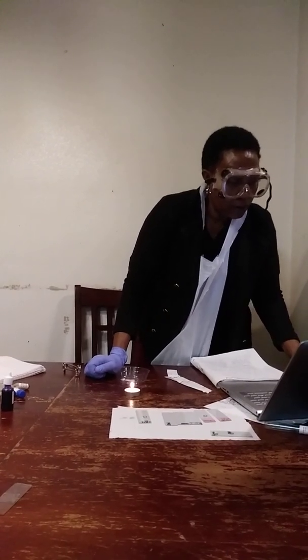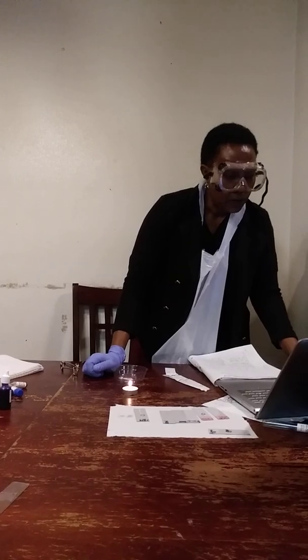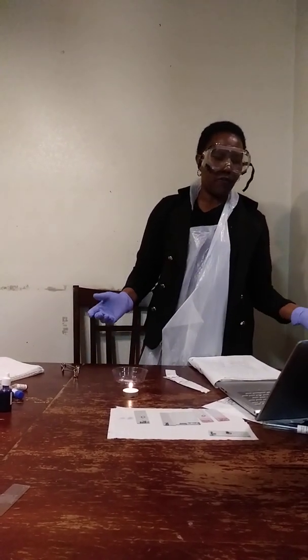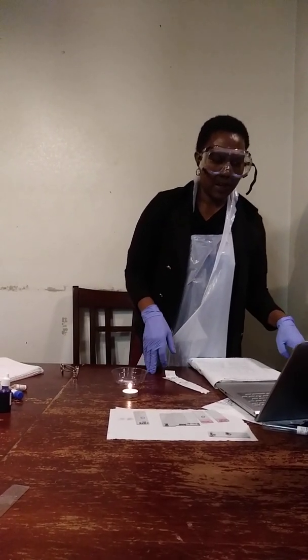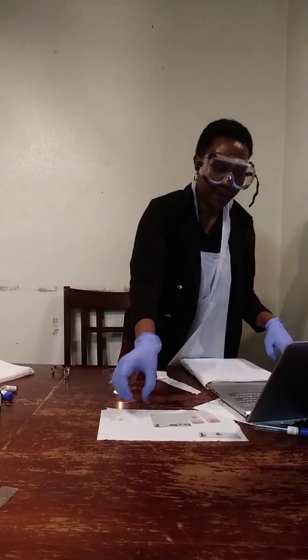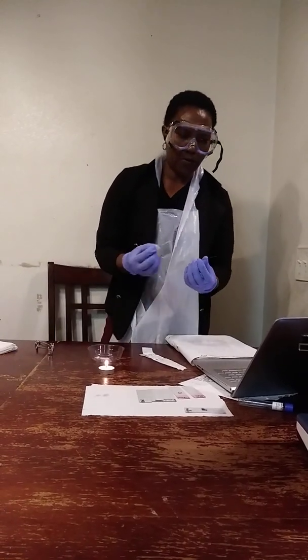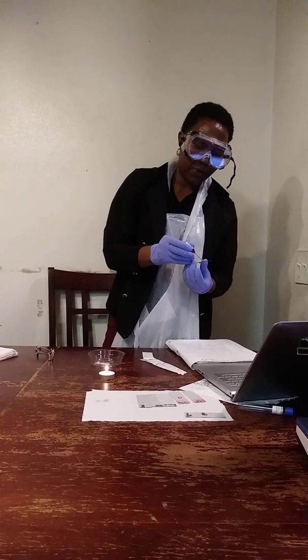And so the second one that I will do is the negative one, which indicates that the procedure will involve a negative stain. And M indicates that I will take this stain from the mouth. And so I will put a drop of Congo red on the slide, on the labeled part.